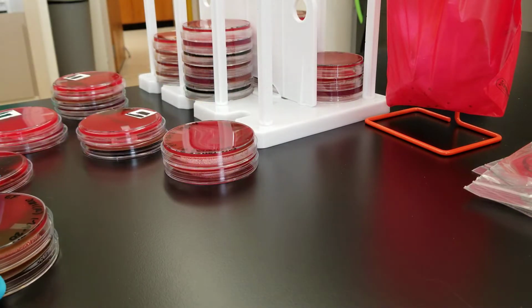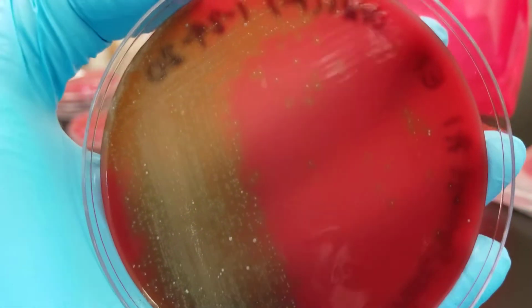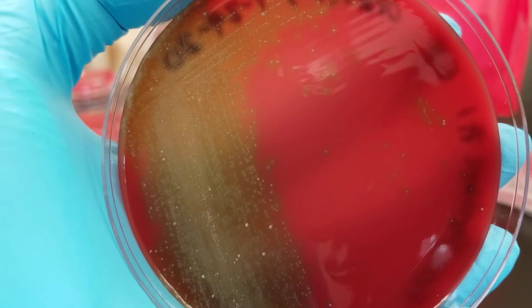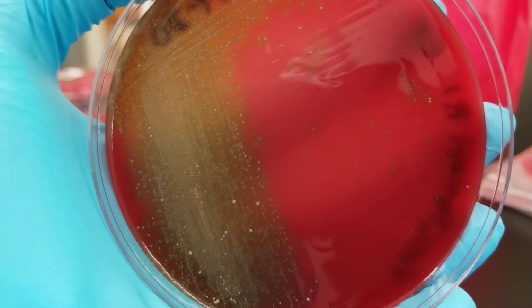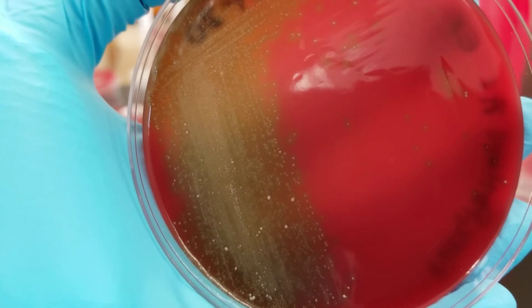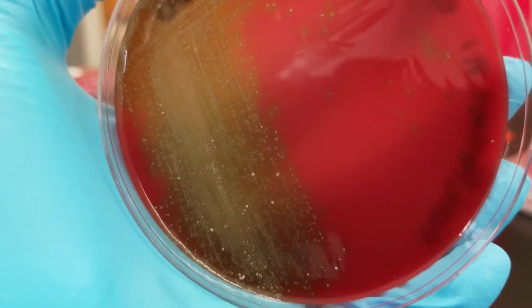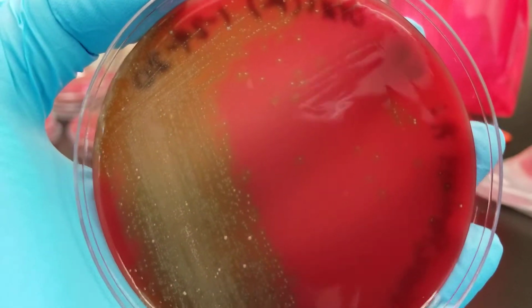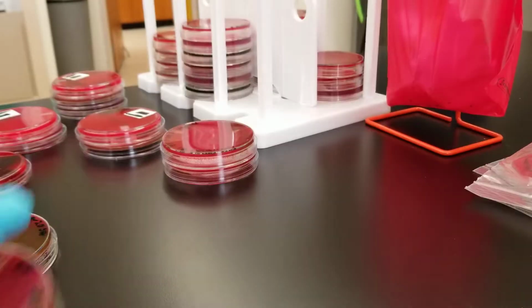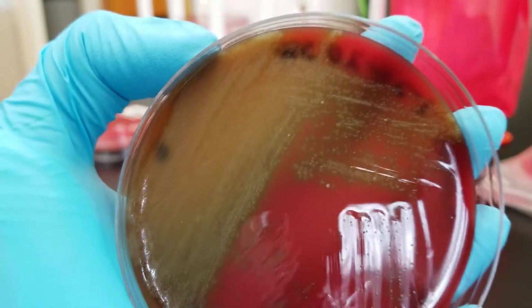Okay, now we're going to go with an oral location. So this is all normal oral flora. These were taken, the oral cavity was swabbed purposely to get normal flora, so you can see the difference between the pathogen and normal flora. So all this growth, yeah, there's growth, but you don't need to work it up. This is all normal.